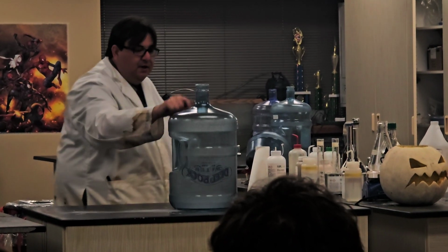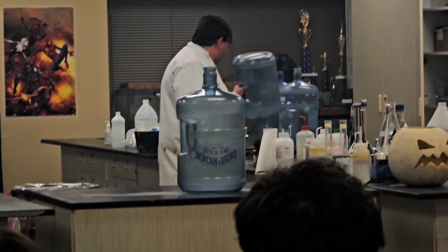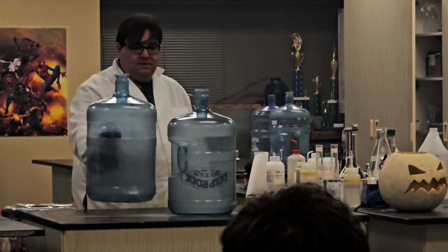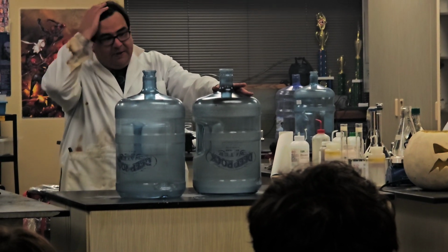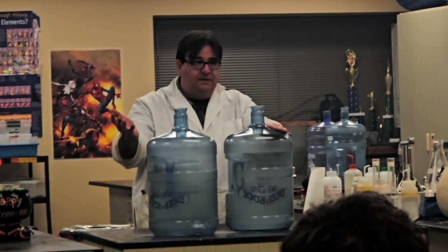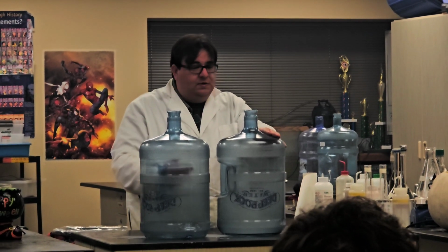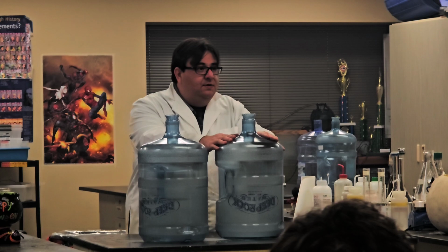Okay, lights on. So if you now look at this, it's super, super foggy, okay? If I take one that hasn't been used, you can see that there is a difference between the two, because this one had a combustion reaction in it. One of the products of the combustion reaction is carbon dioxide. What happens to fire and carbon dioxide? Does fire like carbon dioxide, yes or no? It does not, okay? Or else fire extinguishers would be kind of pointless. So we're able to keep the fire out.